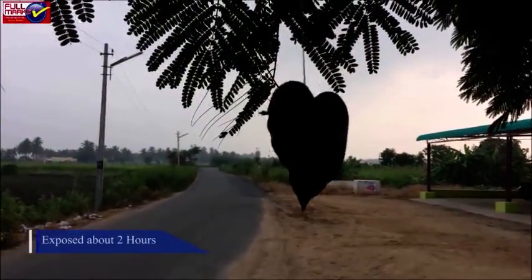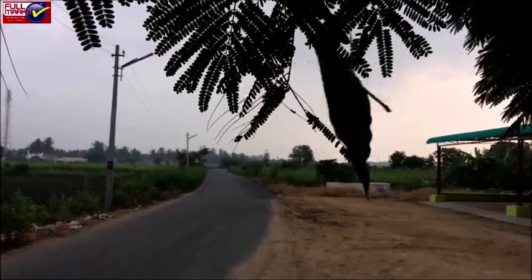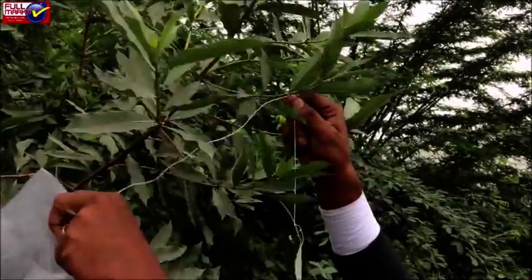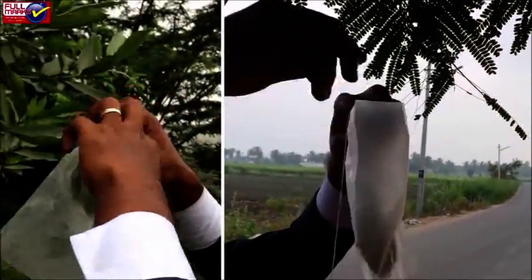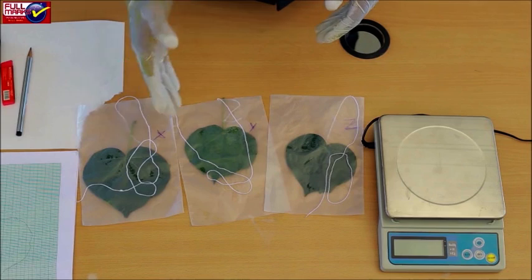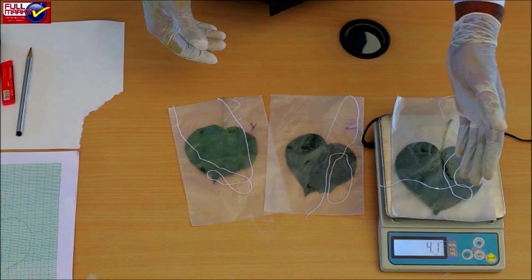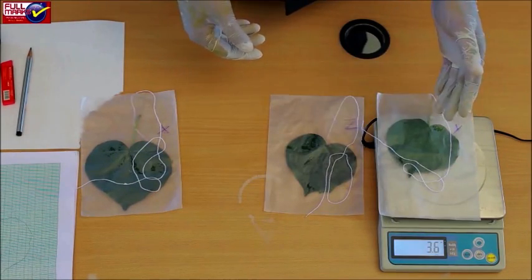Keep the leaves exposed for about two hours. After exposure, collect the leaves from each spot, carefully re-bundle the exposed leaves, and place them along with the string in their corresponding polythene covers. Return to the laboratory. Again, weigh each bundle of exposed leaves along with their respective polythene covers and record the values. The weight of suspended particles can be calculated by the difference between the weight of leaves after exposure and the weight of leaves before exposure.